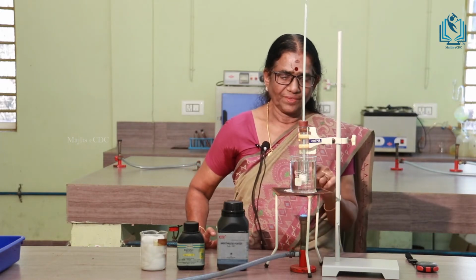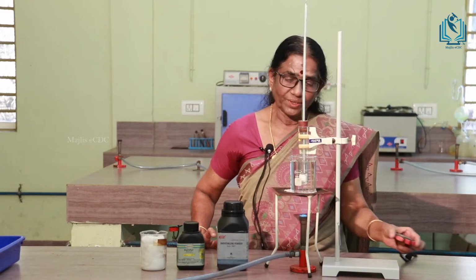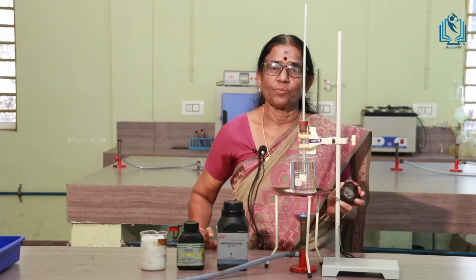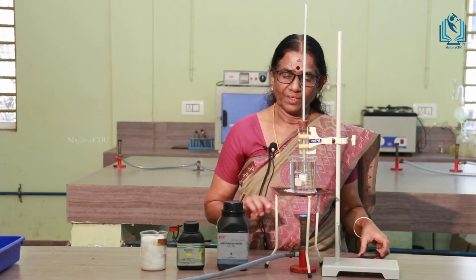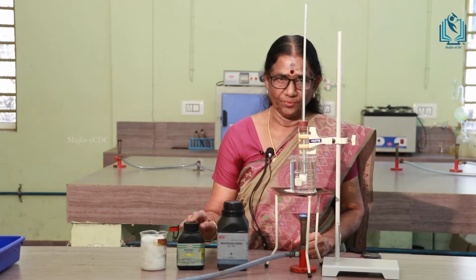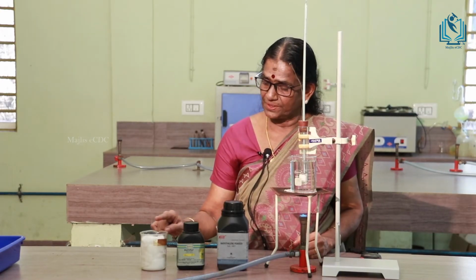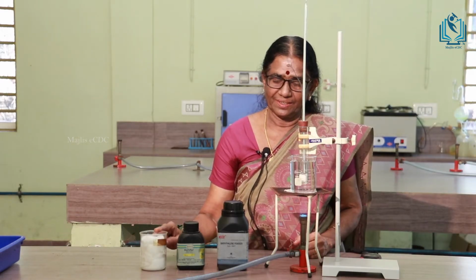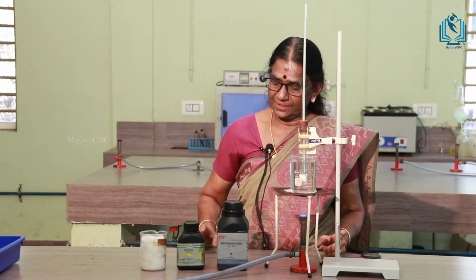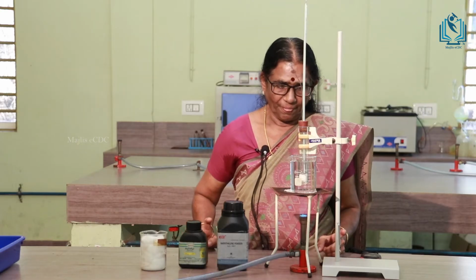Then on heating, the substance will melt. So, we have to note the temperature at every 30 seconds. For that we are using a stopwatch also. Then for repeating the experiment with the solution, that is by adding solute, we have to cool it first, and then for that purpose we are using an air jacket. So, these are the equipments and chemicals required for Rast method. This is a solute, biphenyl is taken as the solute here.